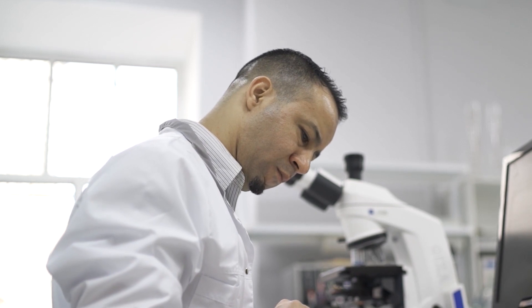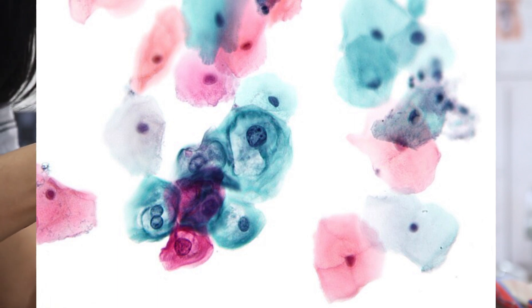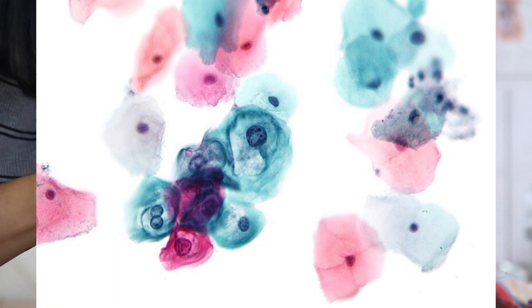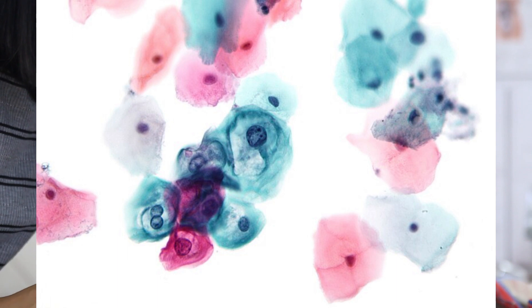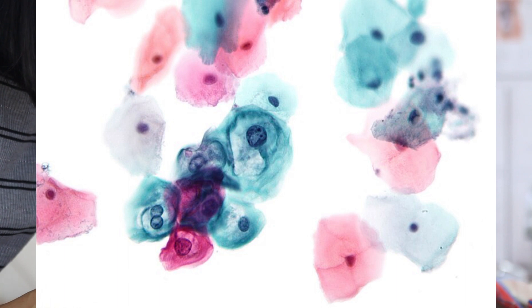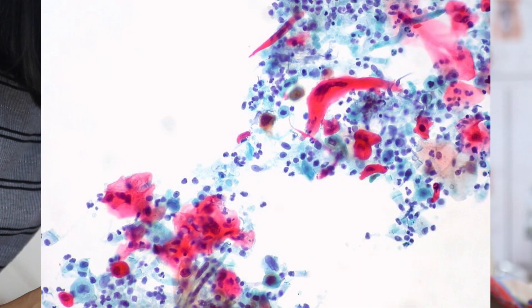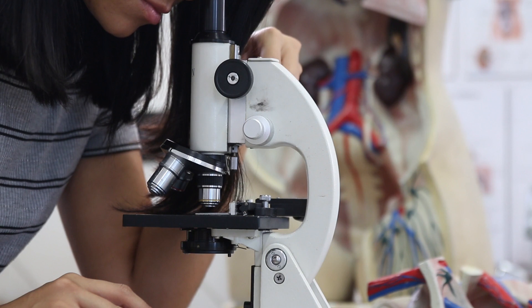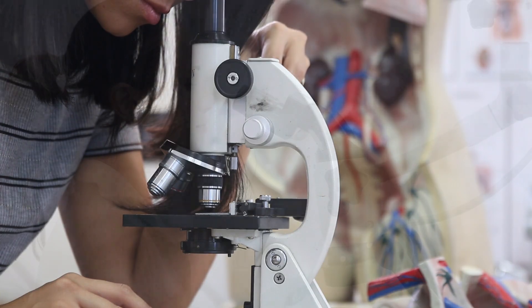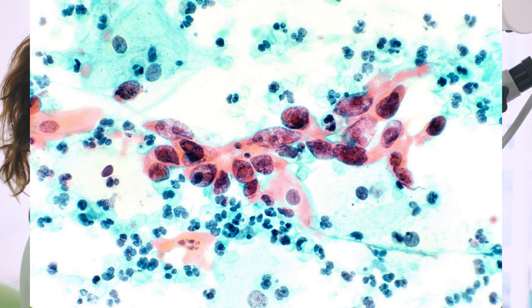The final common stain is the Papanicolaou stain, also generally referred to as the Pap smear stain. It's used to detect cervical cancer within the cervical swabs of female patients. The cells are exposed to it after being collected. After being processed, the cells are given haematoxylin for the nucleus, orange G for keratin, eosin for structures, light green SF for cytoplasm, and Bismarck brown. It's effectively a combination of different stains, but it's just treated as a collective stain because it's used for one specific purpose.